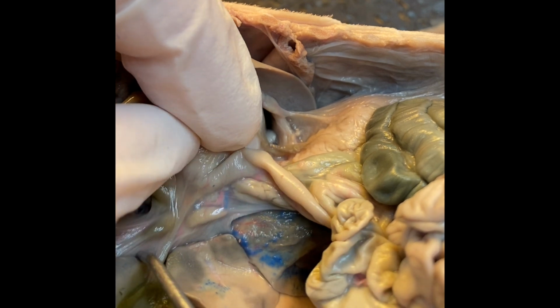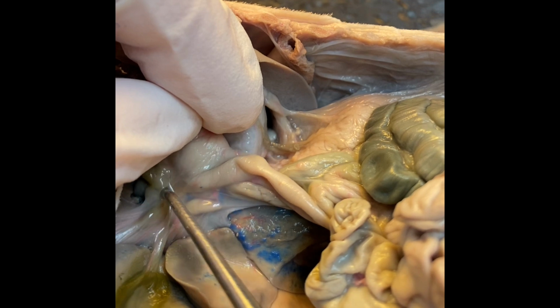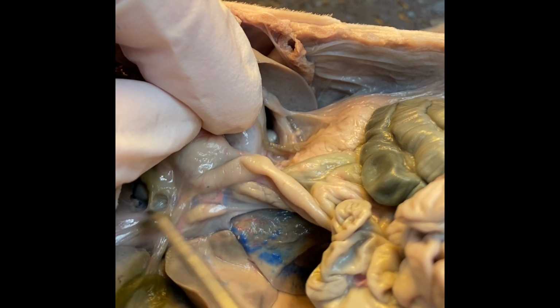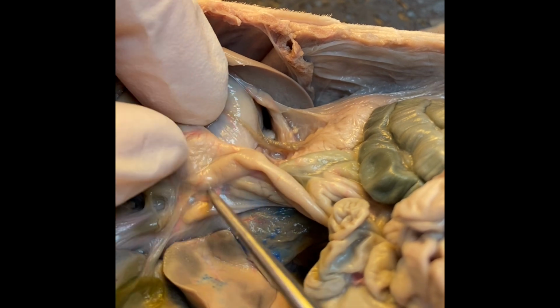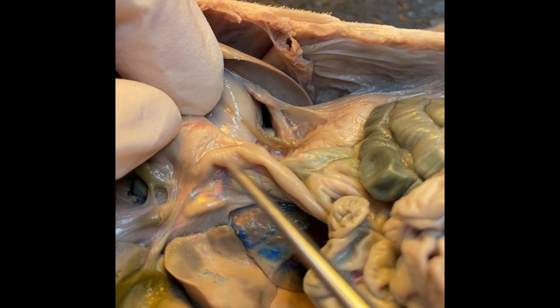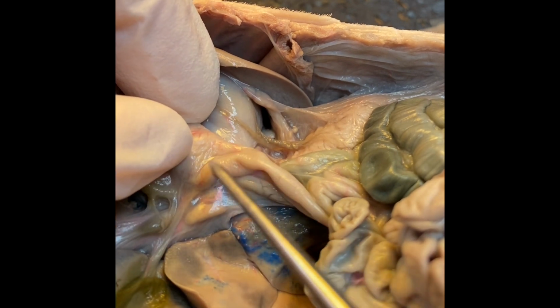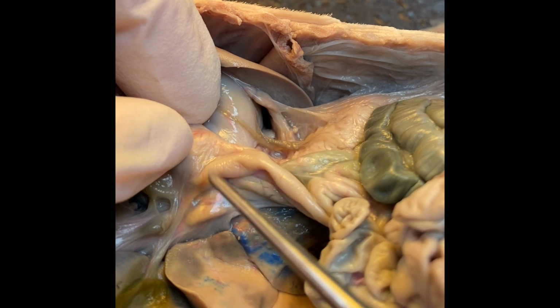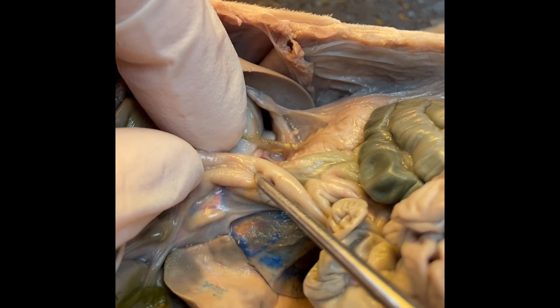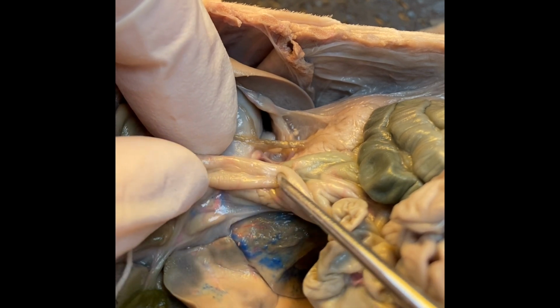This is also where the bile duct will connect. And if you look in this area, you can see the connections all in this area. I would have to lift it up further so you could see where the pancreas is draining into it, but this is where everything starts to enter. So as food makes its way into this region, this is the primary location where absorption and digestion takes place.